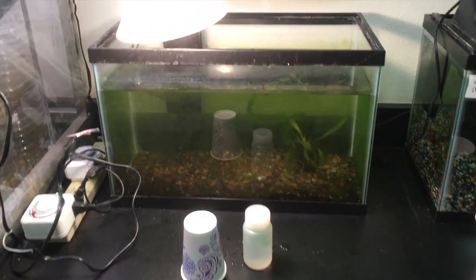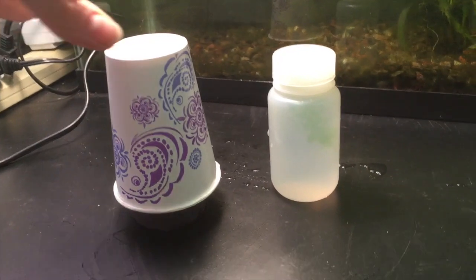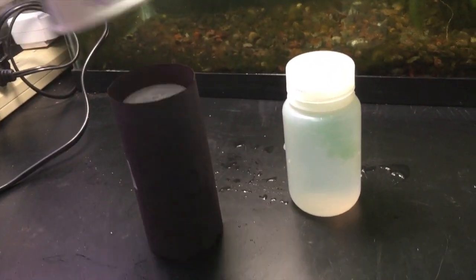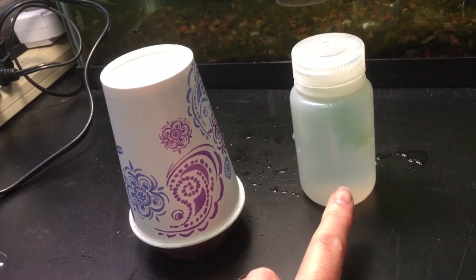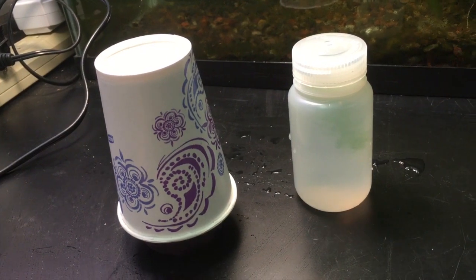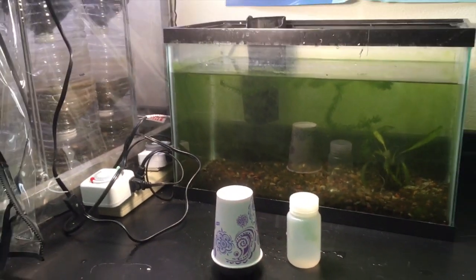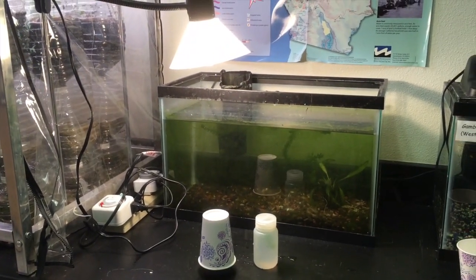Here are the bottles under this light source for 48 hours. I have black paper around one of them, and both bottles are completely filled with water with a small piece of identical elodea in each bottle. They'll remain under this light for 48 hours.